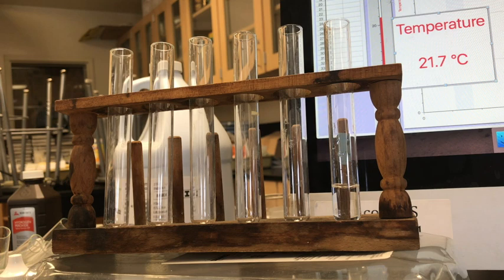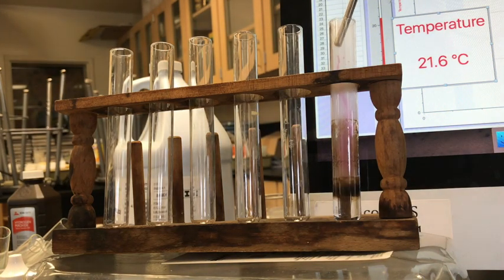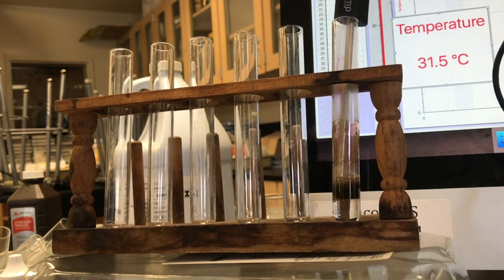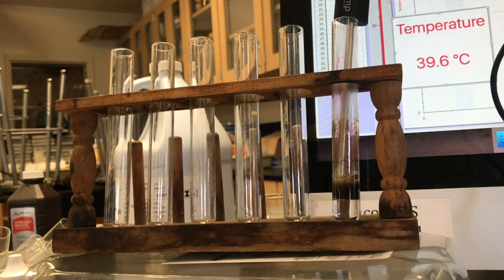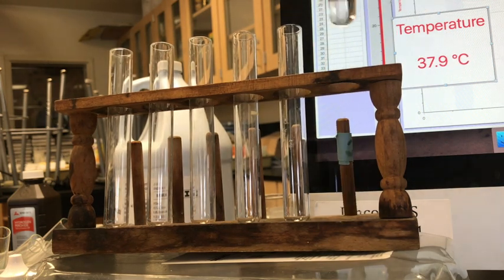So right now, my hydrogen peroxide is getting weaker and weaker, but very, very slowly. The catalyst will make this happen more quickly. And let's see, steam. And we're going to watch. And we can see the temperature is climbing. And so clearly the temperature goes up. Let's mix this up a little bit.